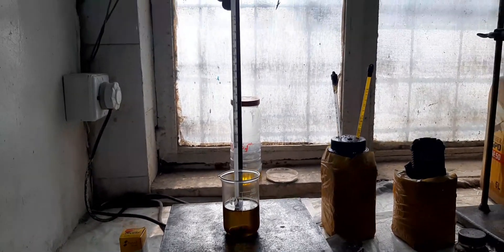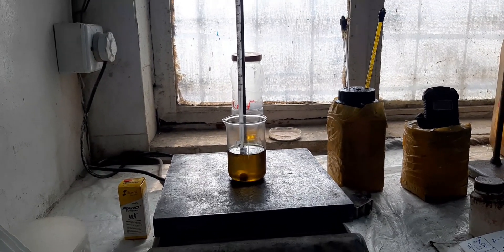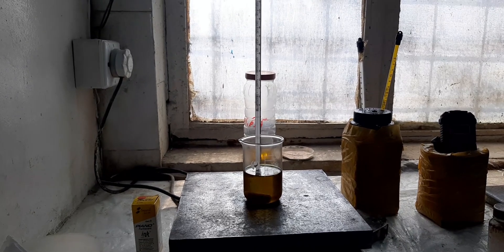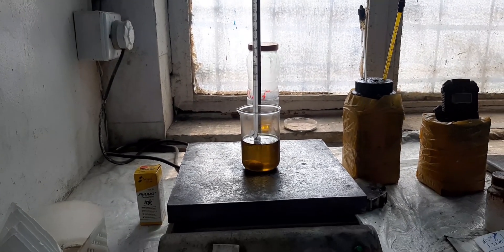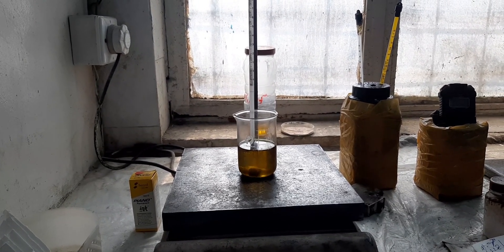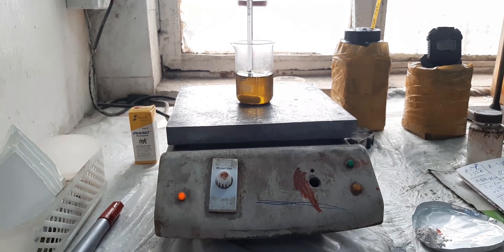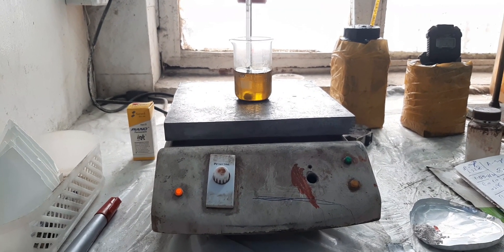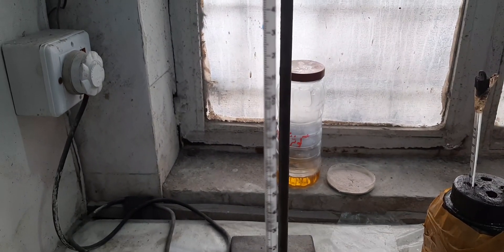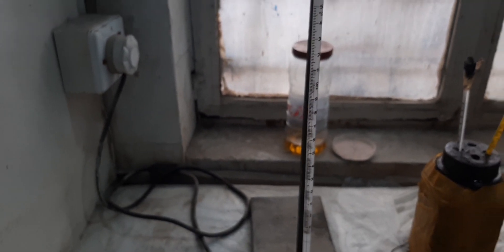Now put the oil on a hot plate and make sure to stir it continuously. We will wait until the temperature reaches 90 degrees Celsius, then add our activated bleaching earth. Continue heating to 120 degrees Celsius and make sure it remains there for 15 minutes.